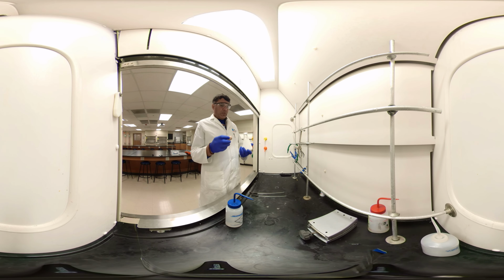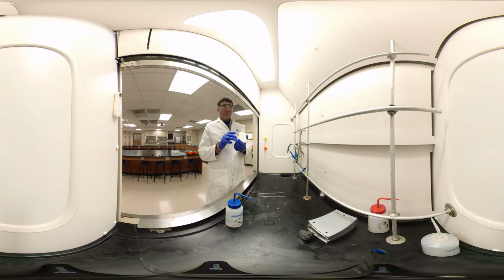Hello everyone. We were going to talk about the disproportionation of benzaldehyde reaction. Last week we mixed benzaldehyde with potassium hydroxide and left it there. Now it must have reacted and produced benzyl alcohol and potassium benzoate.